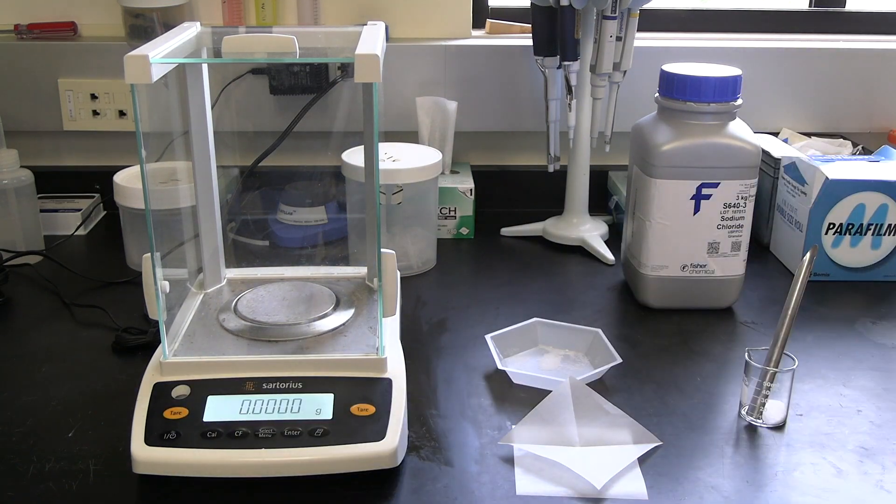And then just tare it again for use for another measurement.